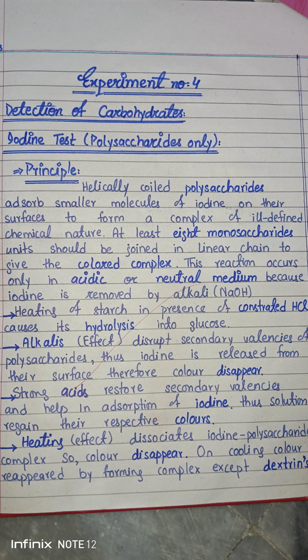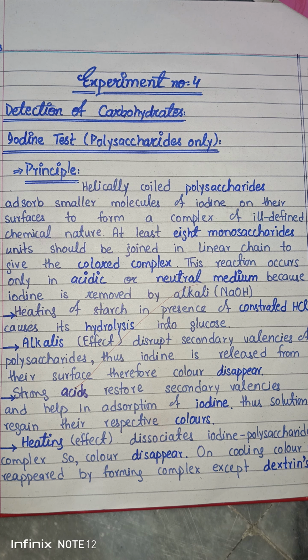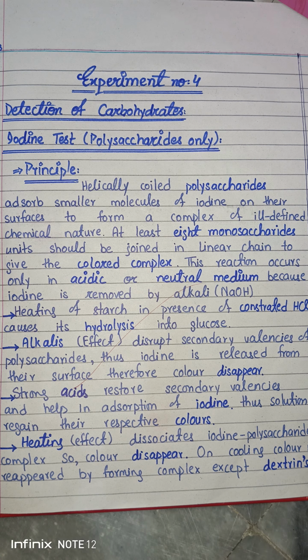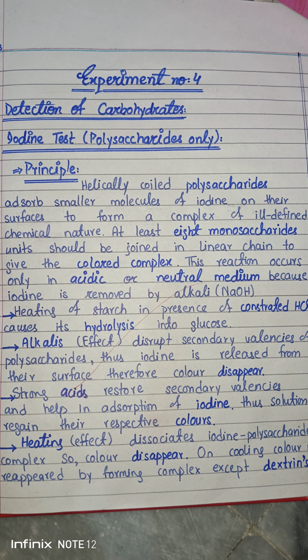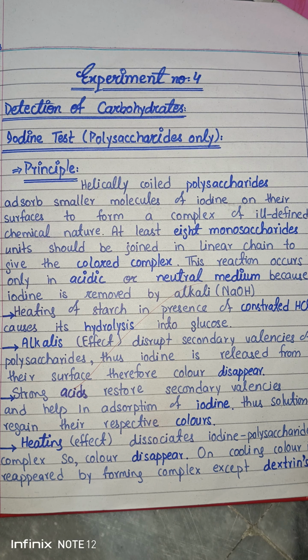Assalamualaikum everyone. In today's video, we are going to discuss another important biochemistry practical, and this practical is about the detection of carbohydrates. In the previous lecture, we discussed how we detect carbohydrates by a famous test which is called the Molisch test. But in this test, we are going to detect our carbohydrates by another important test, which is the iodine test.